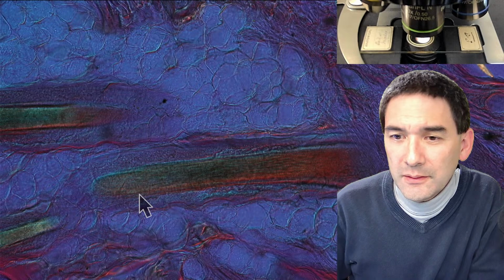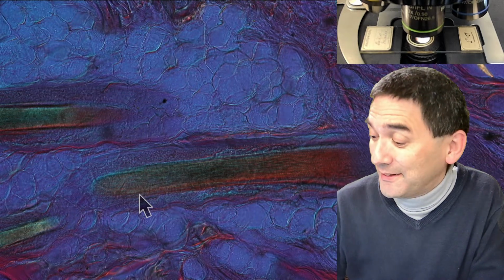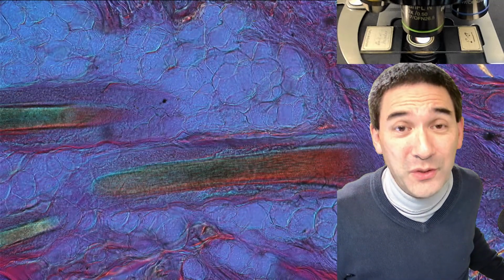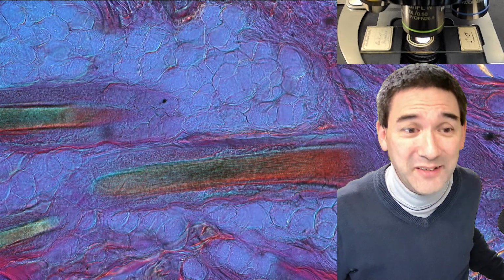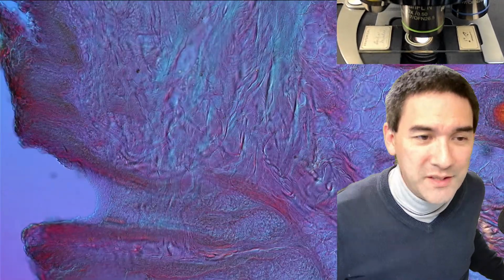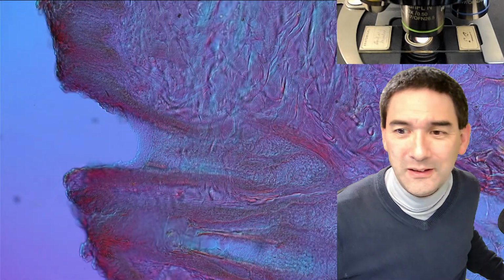Okay. The monkey tail was like an all-in-one specimen. Yes, that's correct. This monkey tail specimen really contains not only bones, not only connective tissue, it contains also follicles, muscles, and blood vessels, all sorts of things. If you're interested in this, you can watch my video. But I just wanted to show this to you here as well. Here, for example, this one over here is an empty hair follicle from the fur.